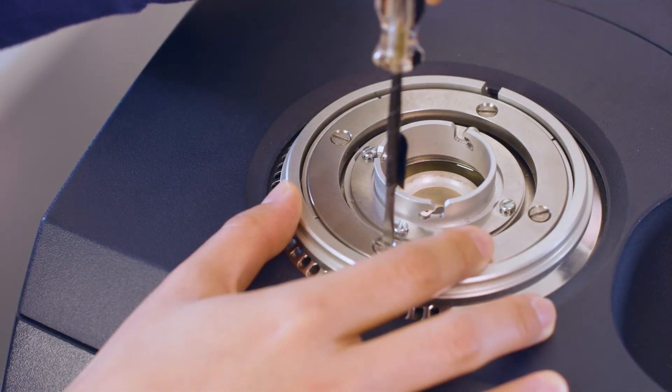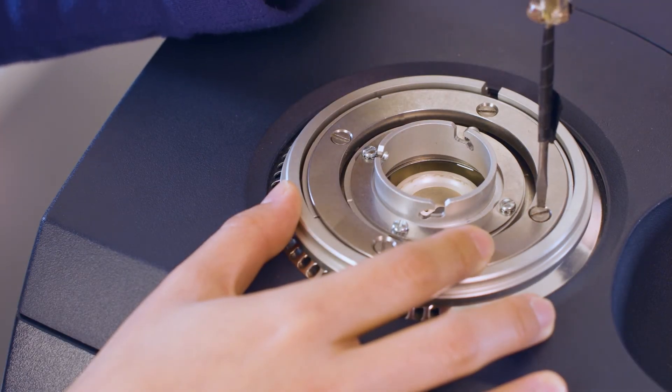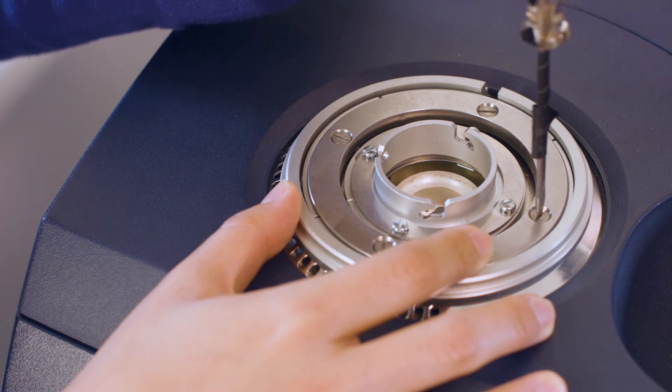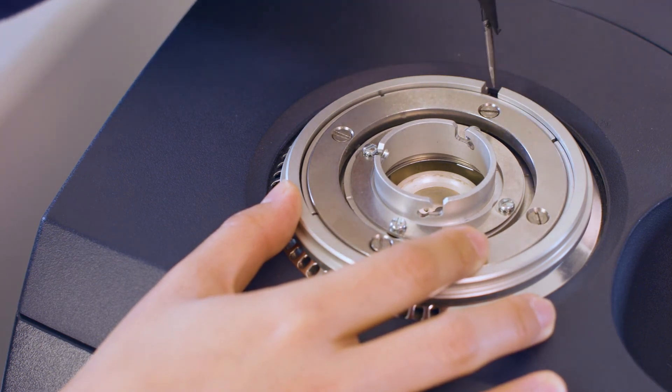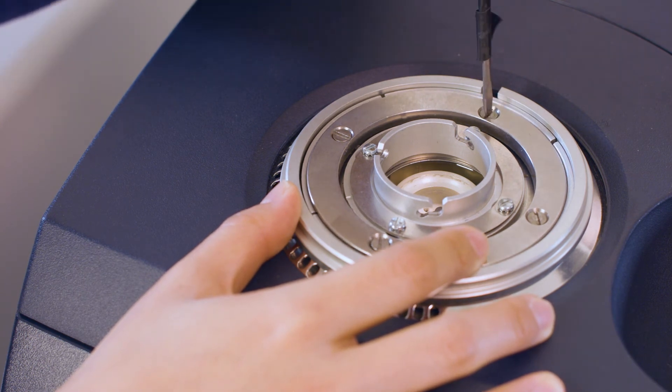Evenly tighten the four outer adjustment screws so that they are just snug. Do not overtighten them. The four inner adjustment screws can be used later to make minor adjustments to the position of the light guide adapter if needed.